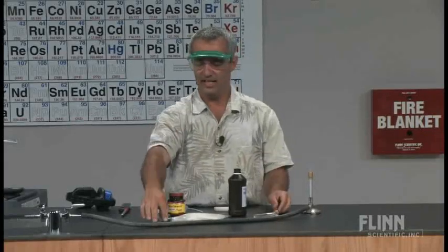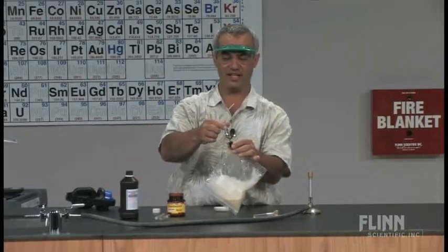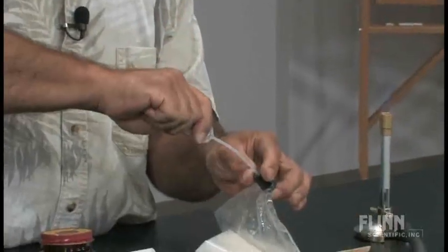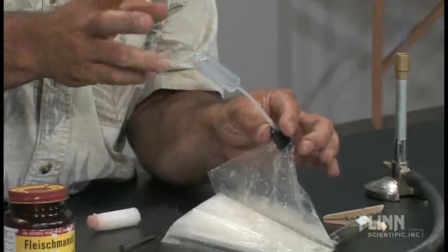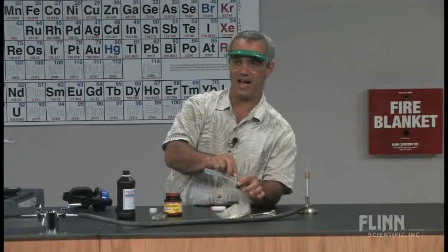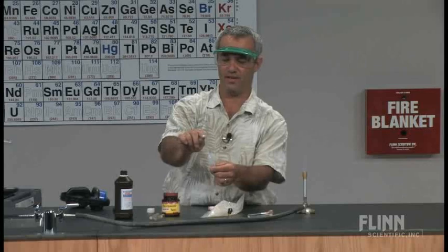I've generated enough oxygen just while talking to do this demonstration probably 20 times. Here's the technique: I take out the nail, squeeze the bulb to get rid of as much air as possible, stick that nozzle down into the stopper, then release my grip to draw in just a nice bulb's worth of oxygen. It's not pure oxygen — there's still some air and water vapor — but it's certainly a higher oxygen concentration than the room, which is just 20% oxygen. This will stay in there because I've tapered the tip.